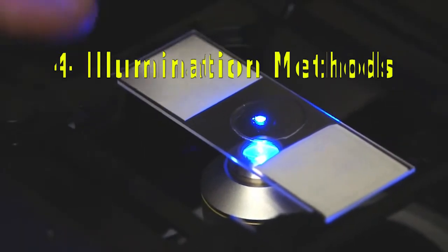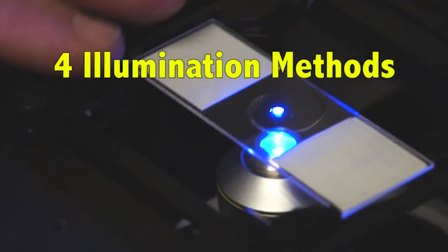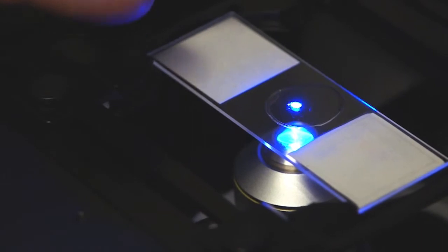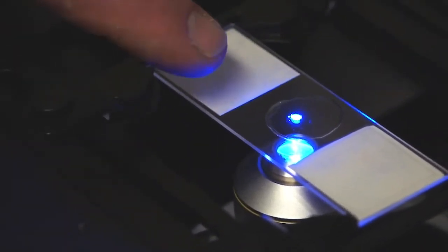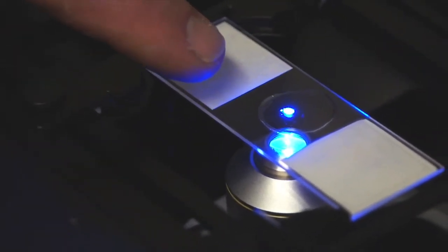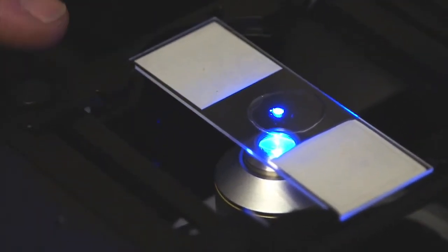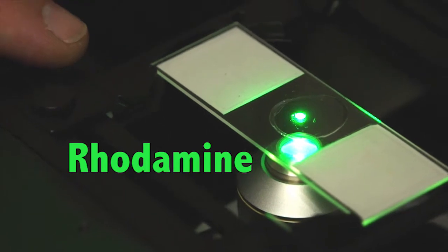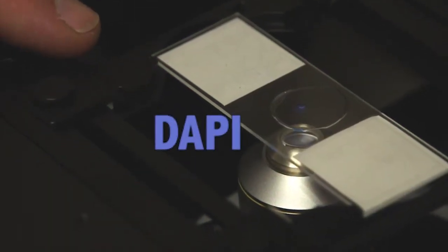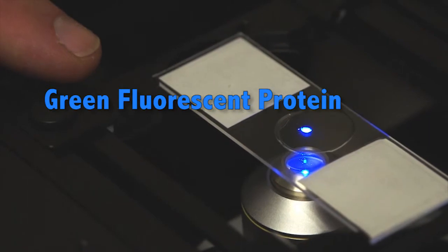We have four illumination methods for fluorescence microscopy on the Leica Confocal Microscope. The first one, as you see here, is for FITC. We also have filter packs for Rhodamine, for DAPI, and for Green Fluorescent Protein.